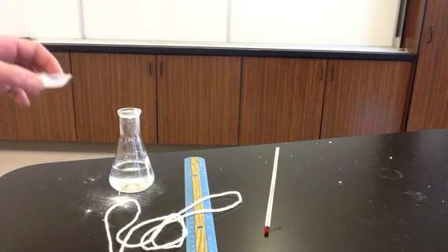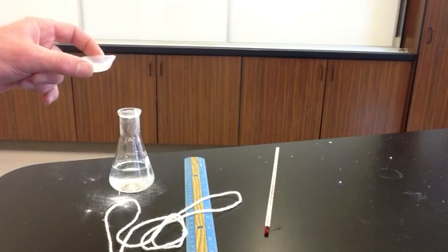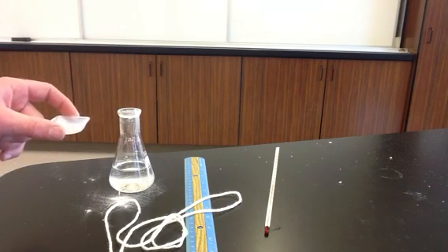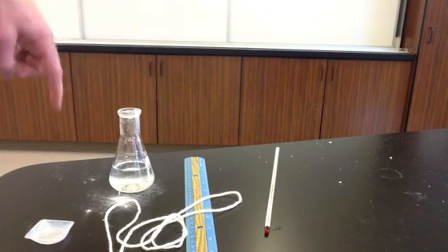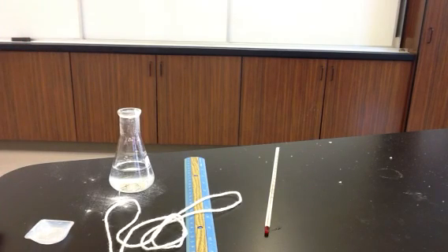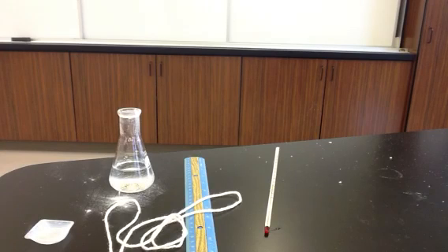So we had 6.1 grams of sodium bicarbonate. We can use that with stoichiometry to figure out how many grams or how many moles of carbon dioxide were produced. We had the circumference of the balloon, 41 centimeters, which allows us to calculate the volume of the balloon, and then we had the temperature, 19 degrees Celsius. And with that information, you should be able to calculate the pressure of the gas inside the balloon.